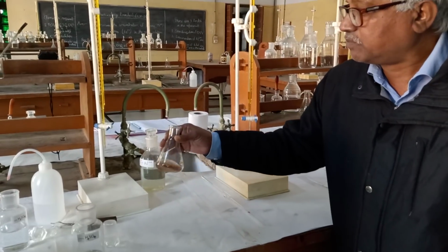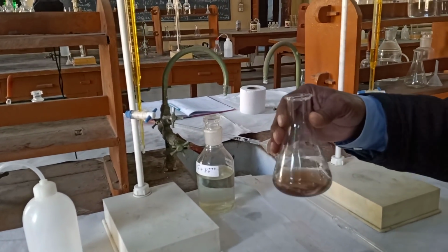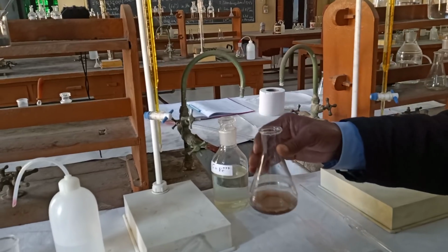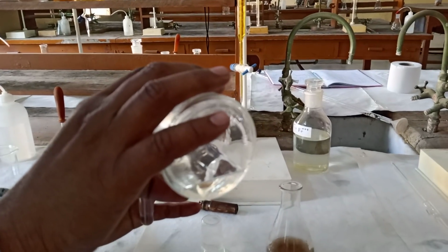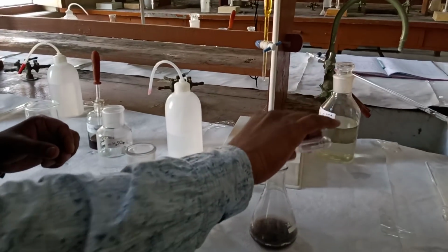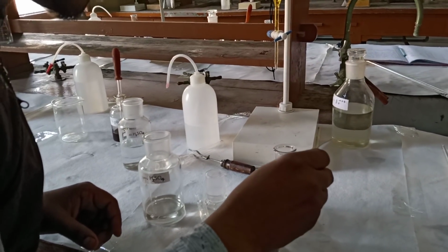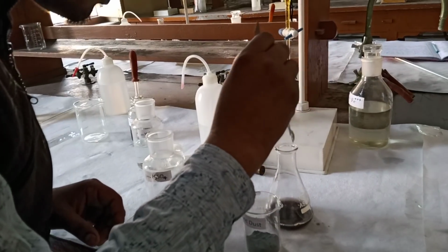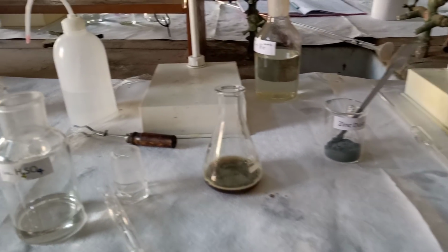In the second part, the mixture, this red violet color will be there. In this same mixture we add concentrated H2SO4, half a test tube, and zinc dust for reduction of iron 3 into iron 2. So you add zinc dust here, a few pinches. One more. Now you can see the reaction is happening here. So this iron 3 is converted to iron 2.